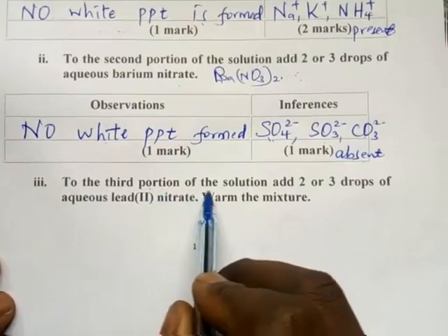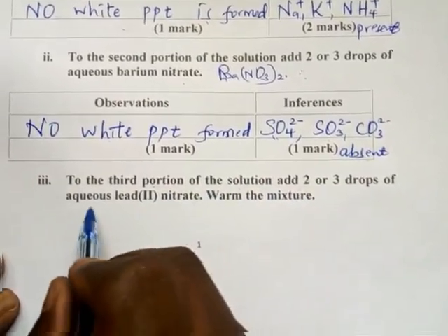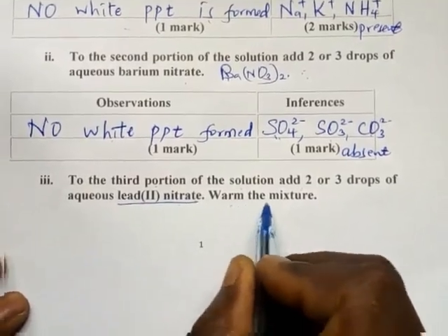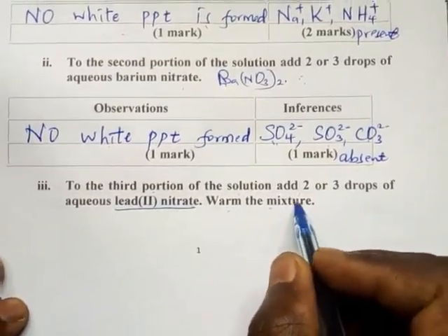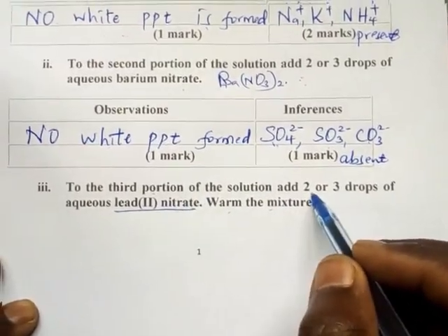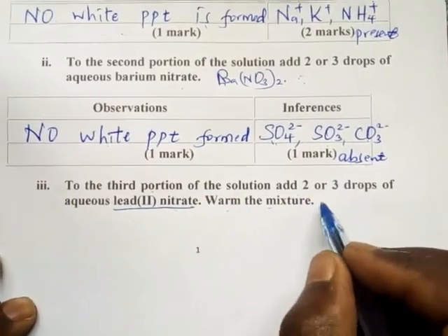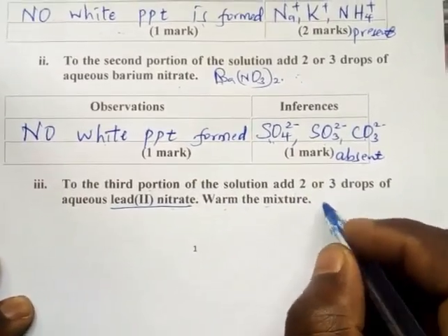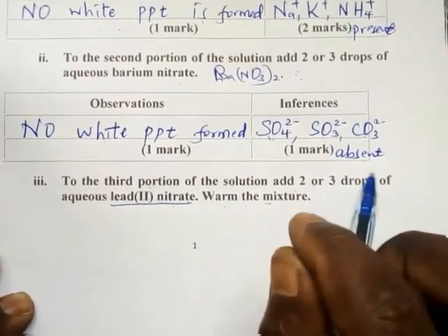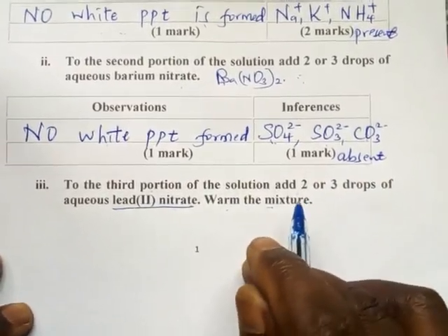To the third portion, add two to three drops of lead nitrate and warm the mixture. Here you need to make two observations: what happened after adding two drops, and what happened after warming. Whenever you have been told to warm, you are expected to make two separate observations.